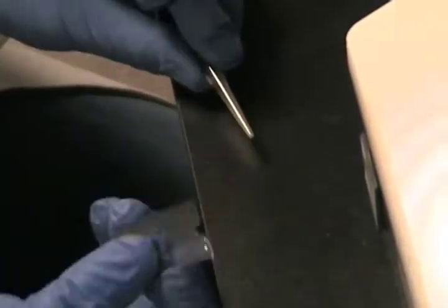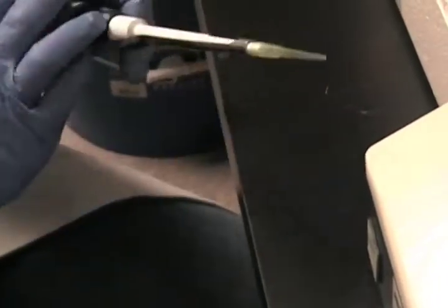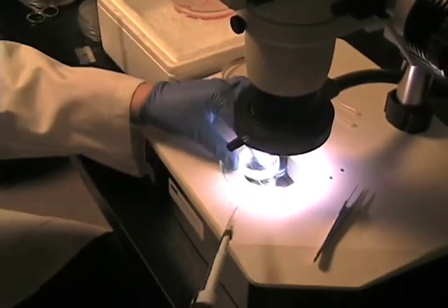So it's very tiny. There are also some tissues still attached to the embryo — you have the ectoplacental cone, which is right here at the apex of the embryo, and also some other tissues still attached. At this point you want to fix the embryos, so I have just a dish of PFA.